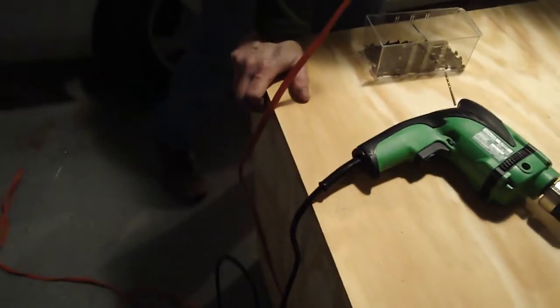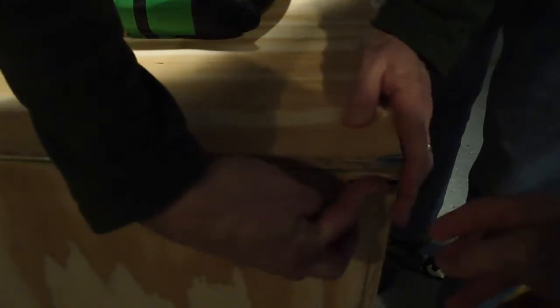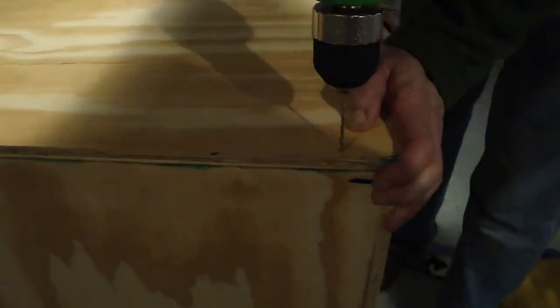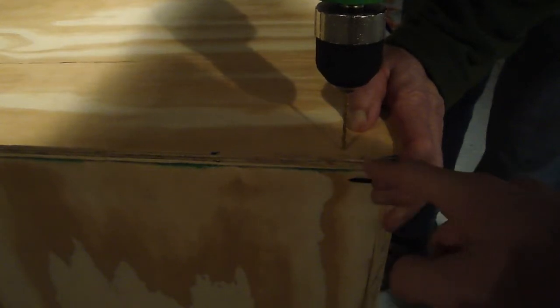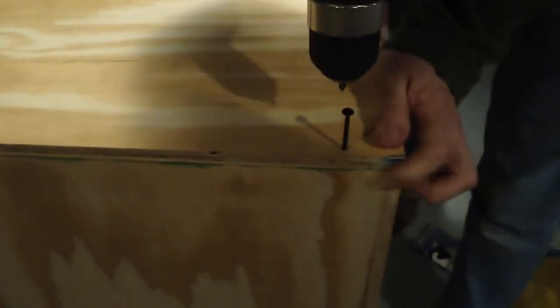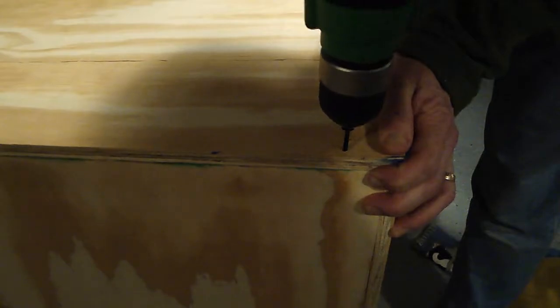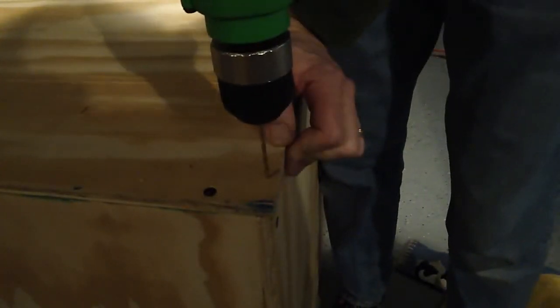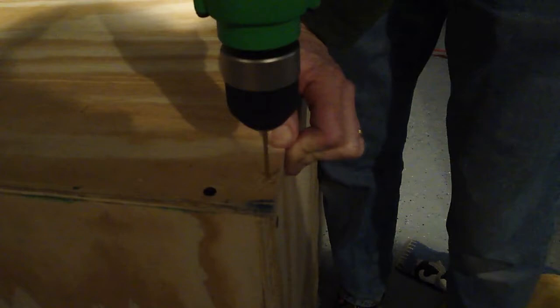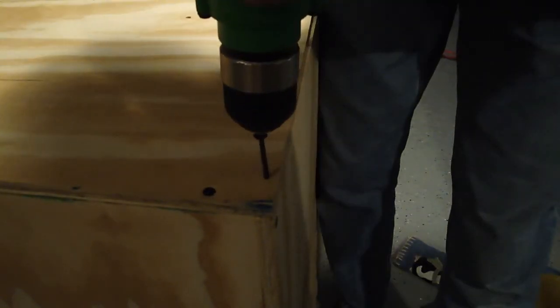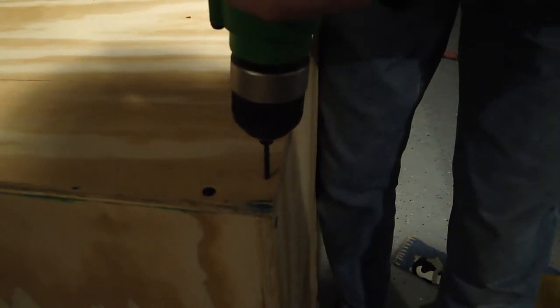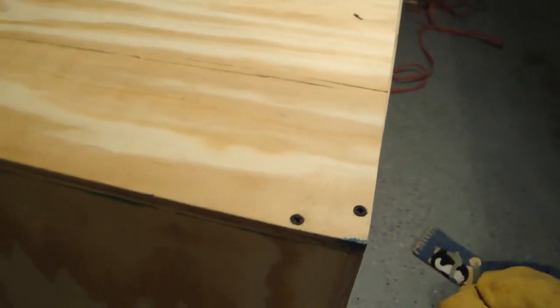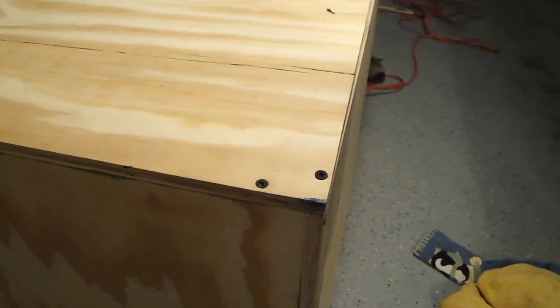Now we've got to screw in on this side, so now we can start doing the back corners there. Drilling the holes for the back, and like we said, we're going to have to do one right there. Screw from the other side is going to be going in about that far. I'm going to have to drill it right here. Put in the screw here. Now we're going to drill the hole on the other side of the corner. Now we're just going to do the same thing on the other side.